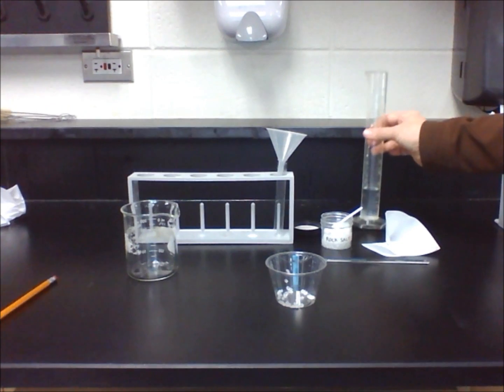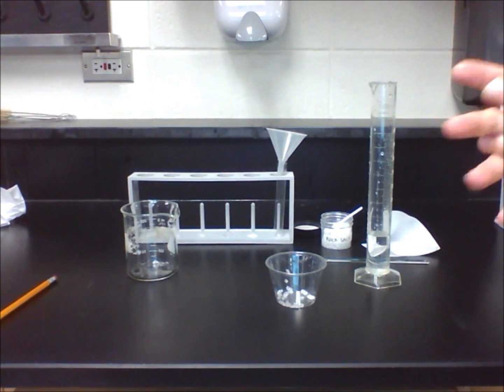So in order to clean rock salt, we are going to come up with a procedure that is very similar to what we did to filter copper sulfate and zinc oxide.